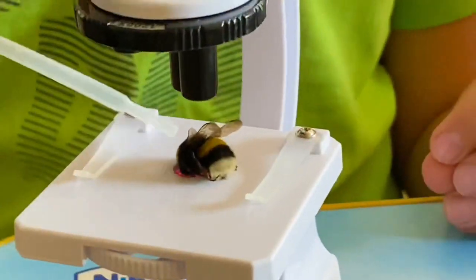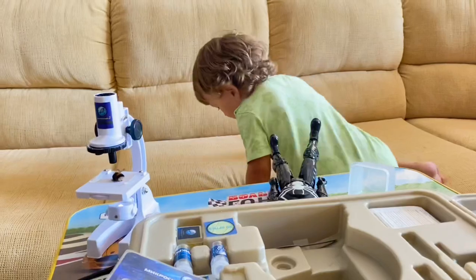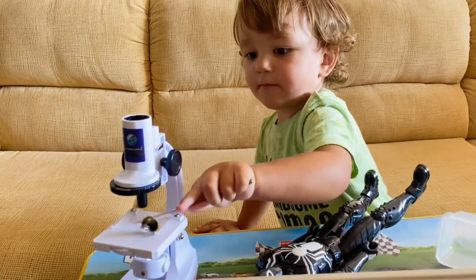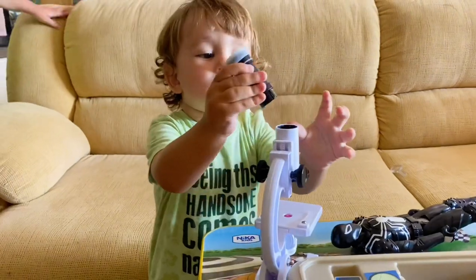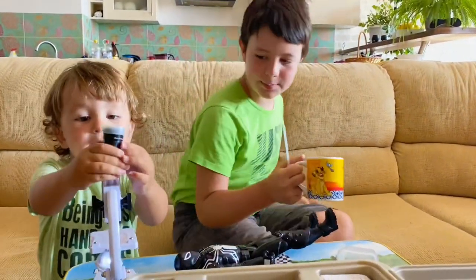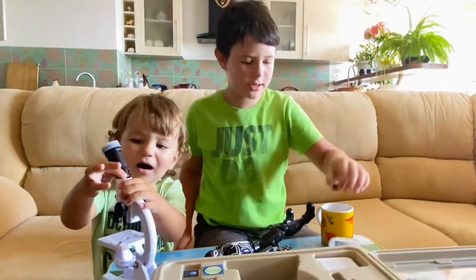And this is what you do to make it watery — you take water and put it onto the bee. Okay, let's take water then. Here we are with the water. I came back with the water. Where's the bee? Oh, here's the bee. And we're just gonna make it a little bit watery — we're gonna put some water on it.